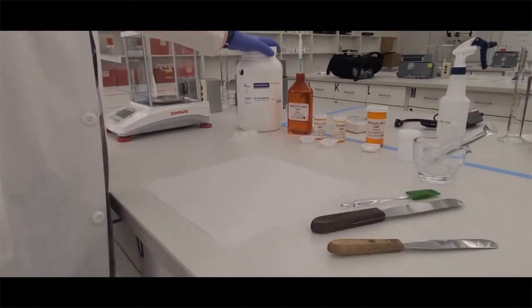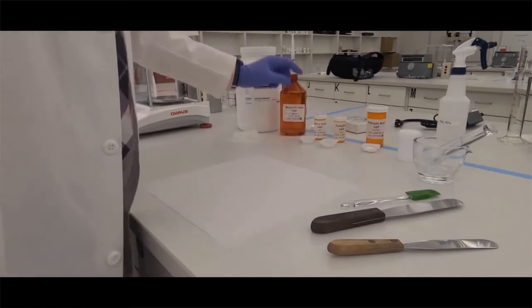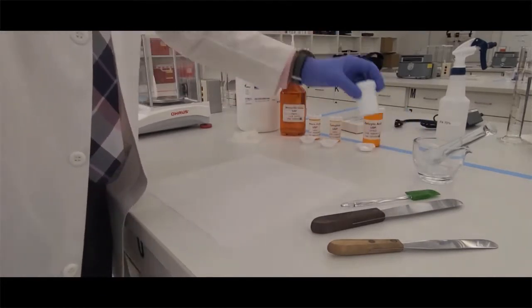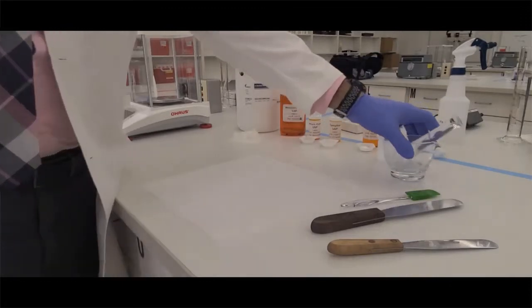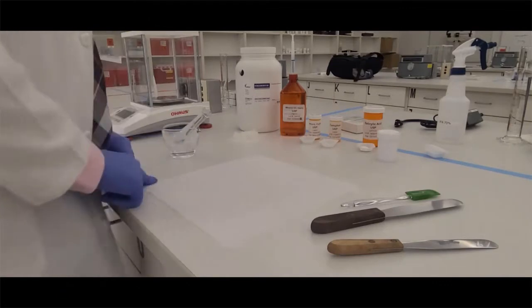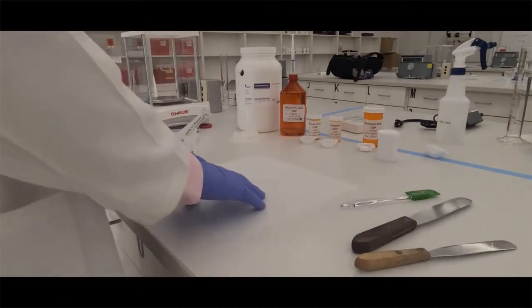So first I'm going to start off with preparing my ingredients by weighing them out and also measuring out my mineral oil. I also will use a container for dispensing and our glass mortar and pestle. On the table, we are going to have another ointment pad. We're going to be taping it down so it does remain in place.